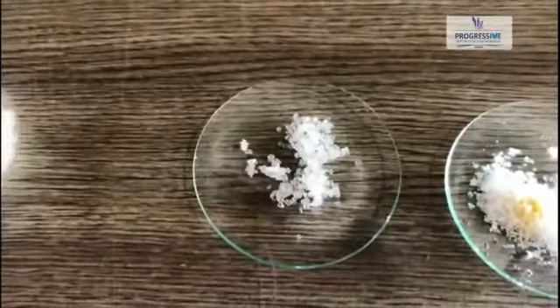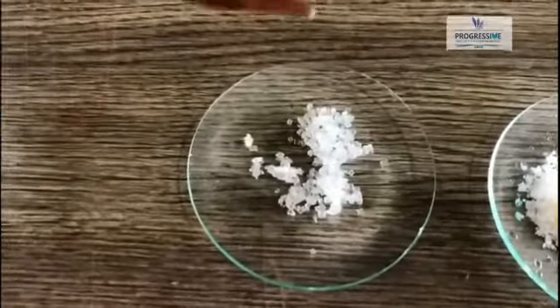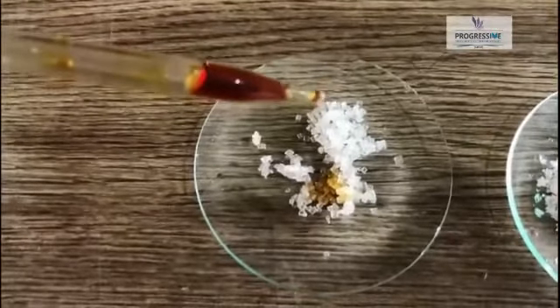Now we are going to add two drops of iodine solution on the sugar. Can you see any color change here? No.